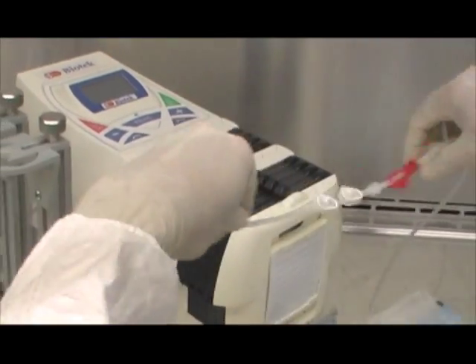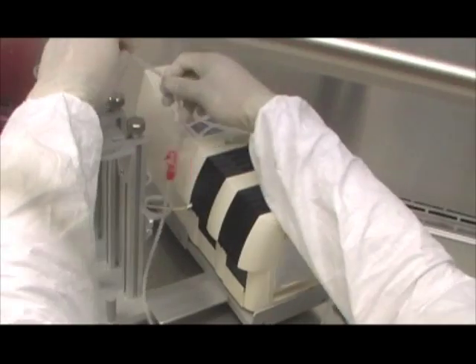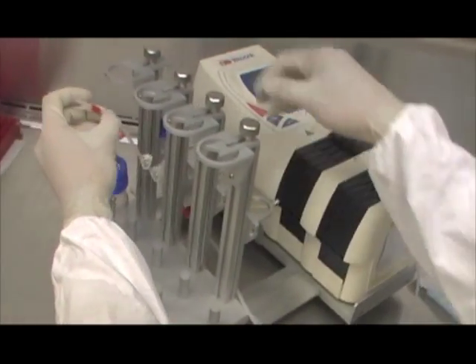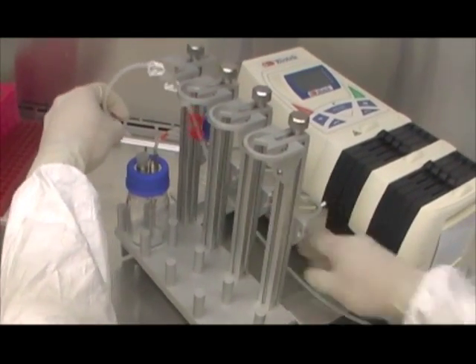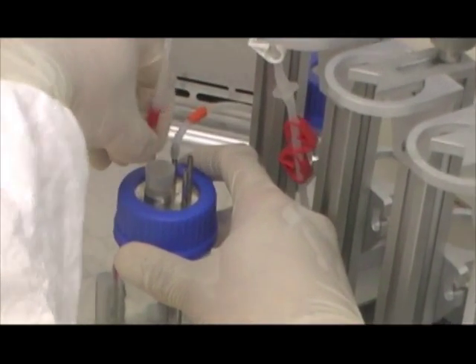Make sure the cassette is firmly hooked. Then bring the remaining media perfusion tubing towards the front between the aluminum stand and the peristaltic pump. Pass the tubing through the bioreactor chamber holder and connect the red tubing end to the letter R on the media reservoir bottle. This completes the media recirculation loop.